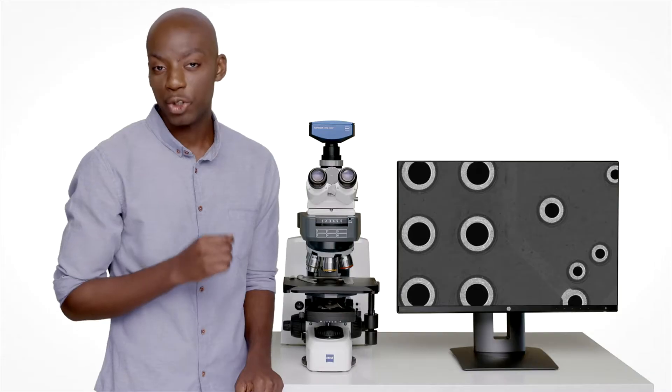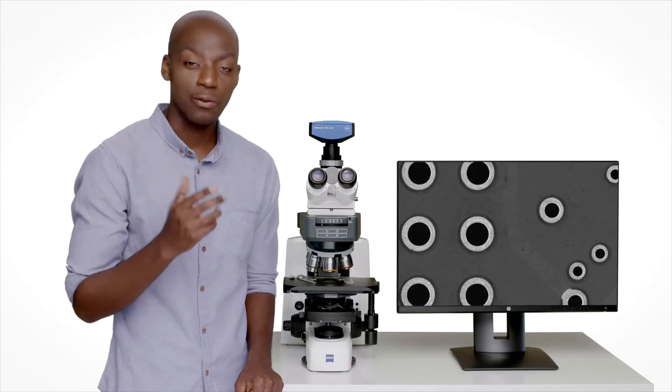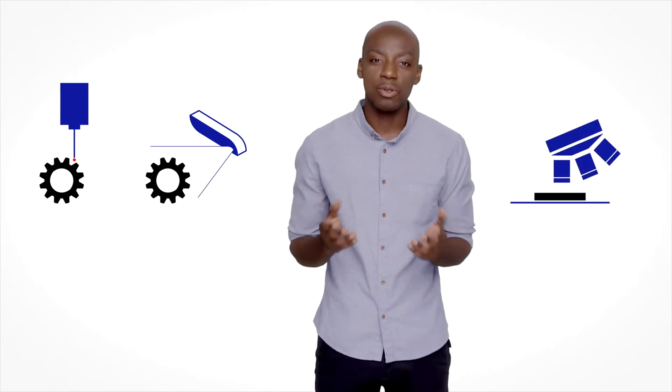Work pieces are getting smaller, and manufacturing tools are able to produce impressively small features with ambitious tolerances. To assure quality you have to measure features too small for the human eye to see. But often measuring devices don't provide the high optical resolution to detect the necessary details, and standard microscopes aren't usually equipped with the necessary measurement capabilities.